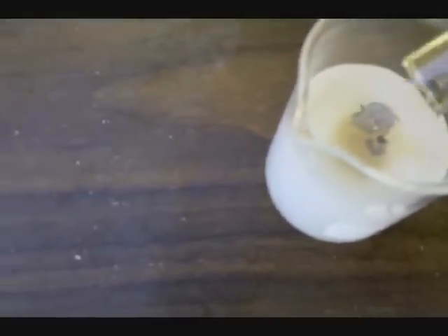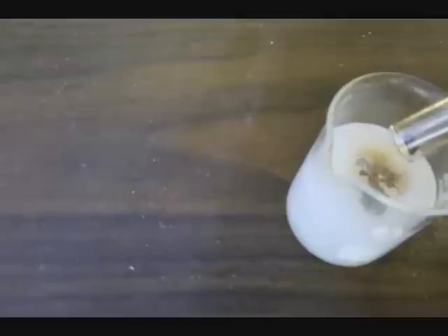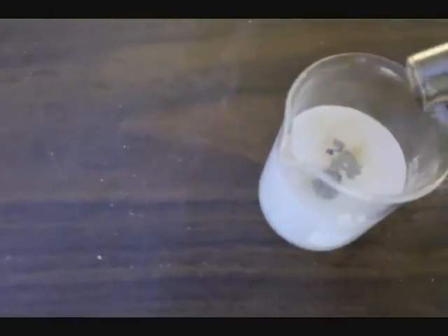It's rather volatile and fumes a lot like bromine, giving off a red-brown gas.